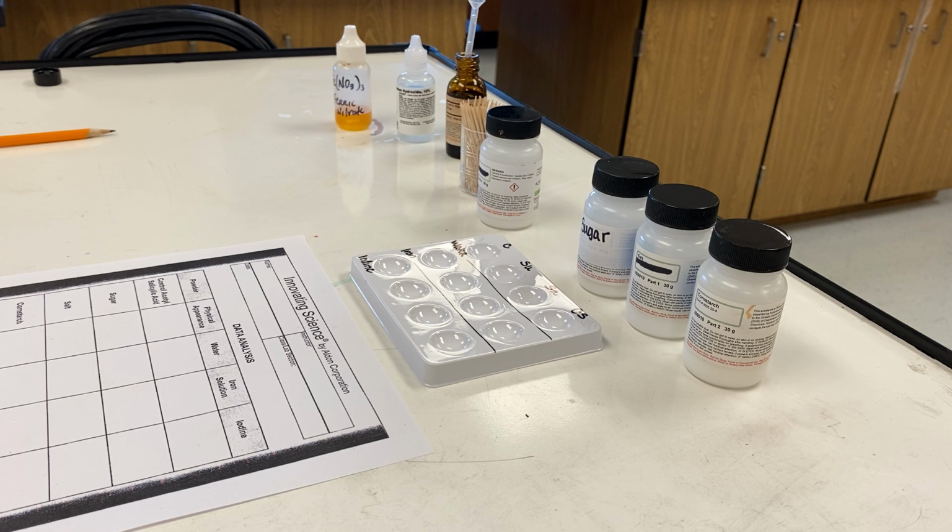So a few things you need to know. Acetylsalicylic acid, which is what is contained in aspirin, decomposes. When it is actually exposed to ferric nitrate, it forms a red-brown color. However, if it is present in another compound, it will turn a deep purple color. Now, the other thing we have to pay attention to is that in the presence of starch, brown iodine will turn into a blue-black substance.